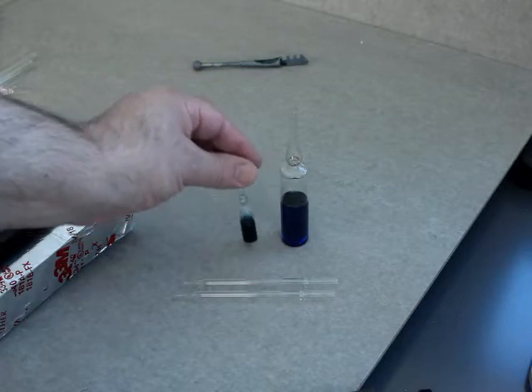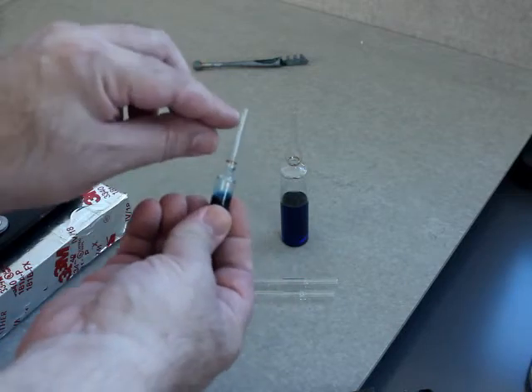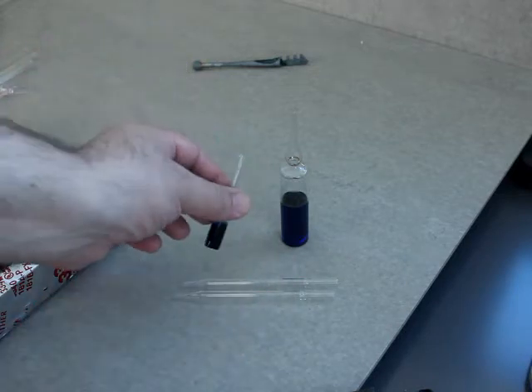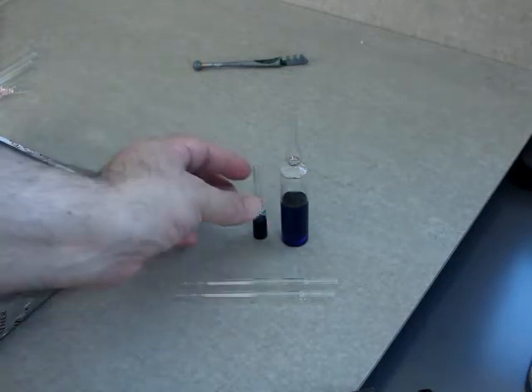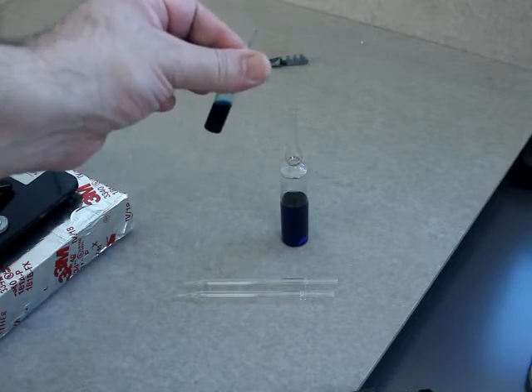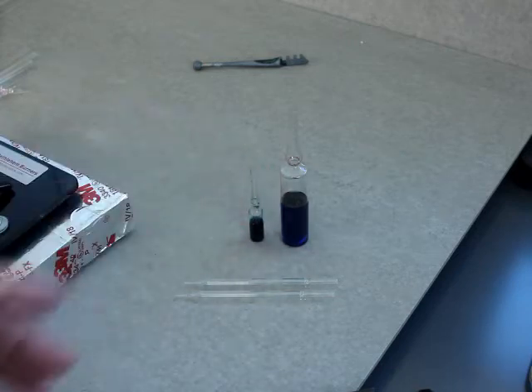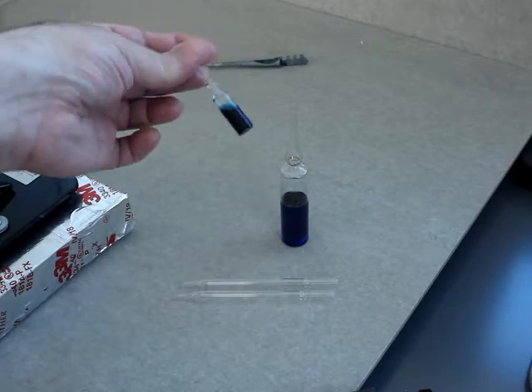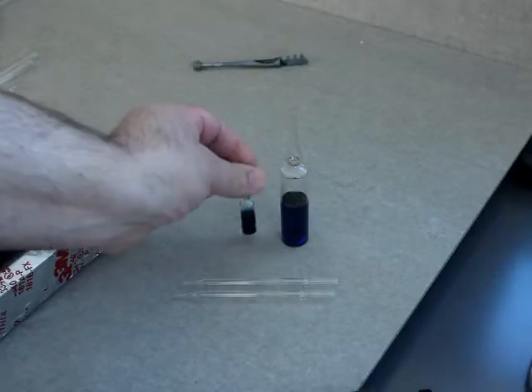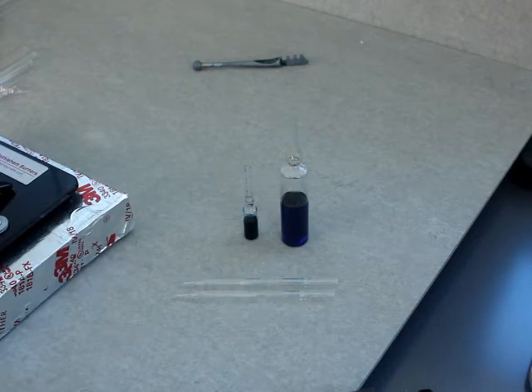What I mean with a glass ampule: normally the top, after you place your liquid or solid in here, would be sealed with a torch under vacuum — typically how we do it in the chemistry lab. In some cases, for pharmaceuticals and cosmetics, they can actually seal these at one atmosphere with the right equipment. These particular ampules are quite nice because they're pre-scored — there's a little line right there at the neck — so snapping it open, usually with a specialized tool, is very easy.